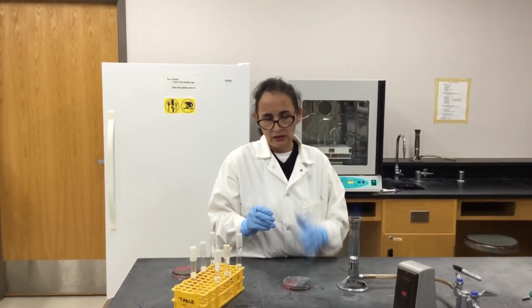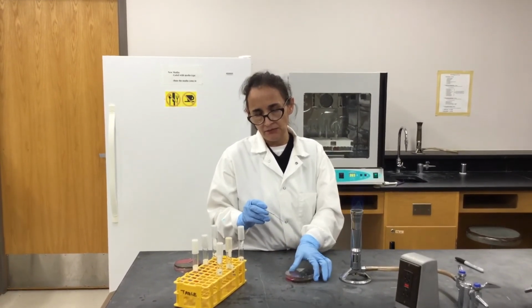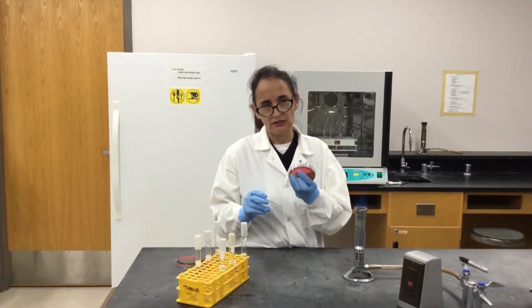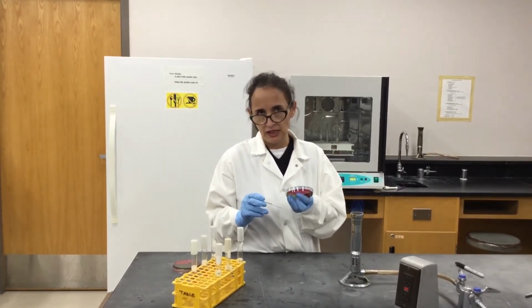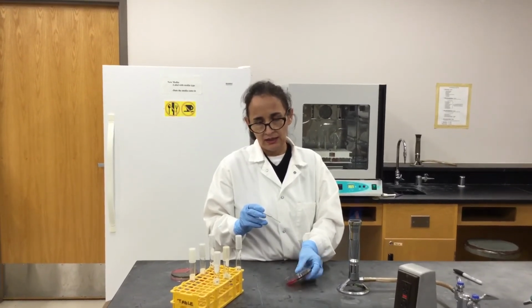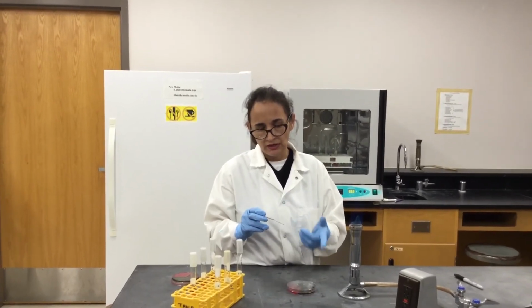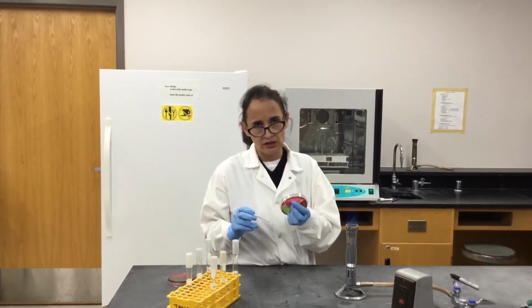Okay, while I wait for this to cool off. Typically media has a pH indicator that is given by certain color, like in the case of MSA. This media is kind of neutral in pH, or concentration of hydrogen ions. And then when you have a change in pH acidity, when you increase your hydrogen levels, this media will turn from red to yellow.